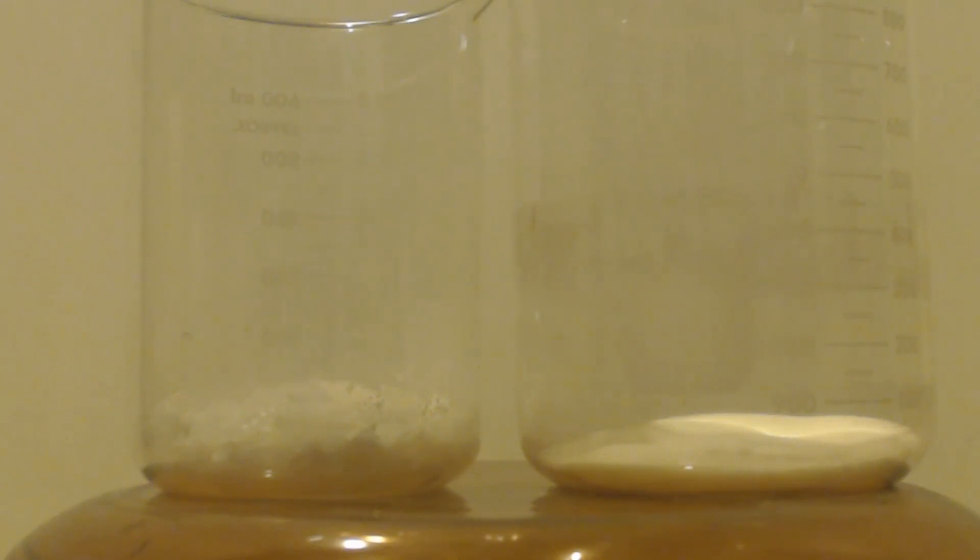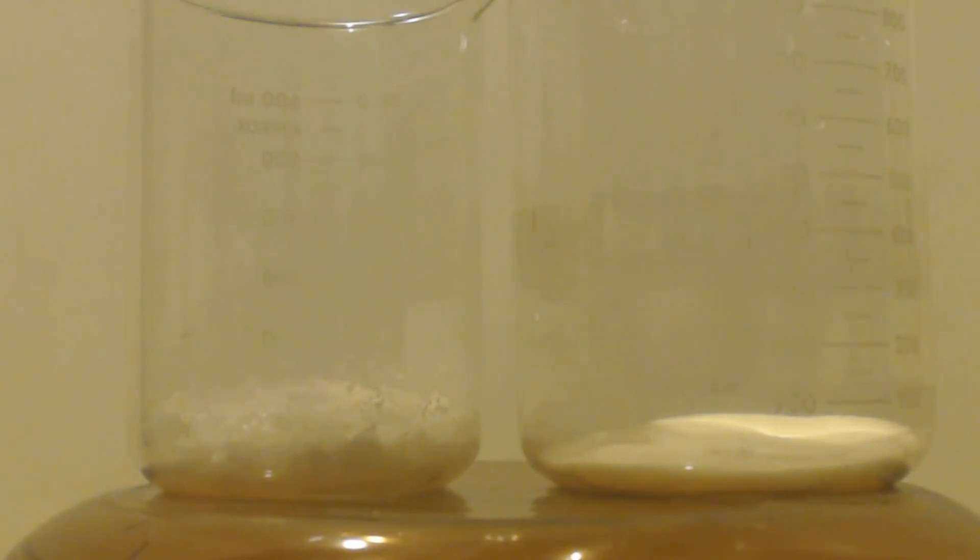I have 125.7 grams of silver nitrate on the left. On the right, I have 51 grams of sodium nitrite.